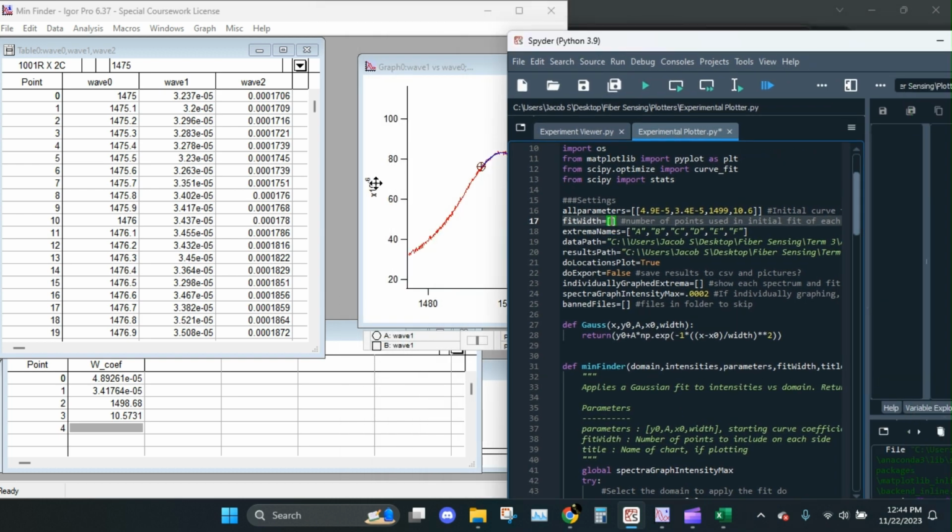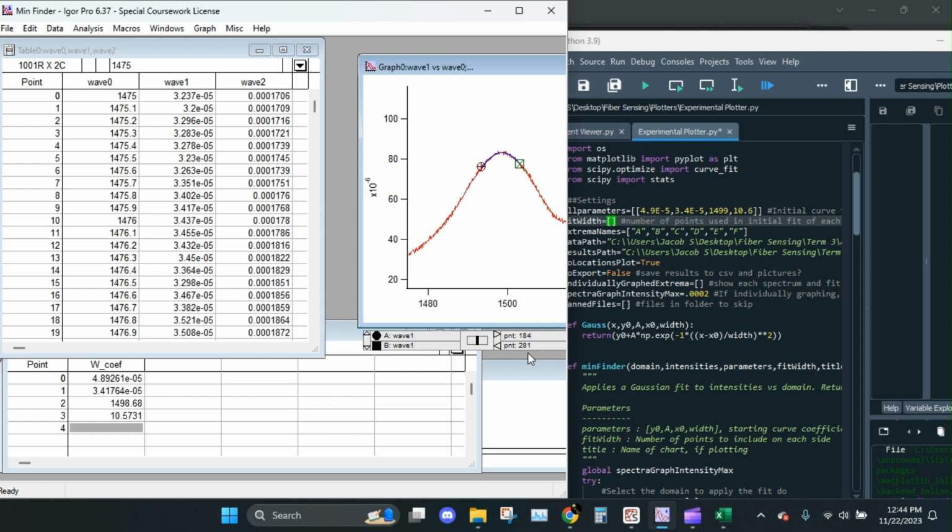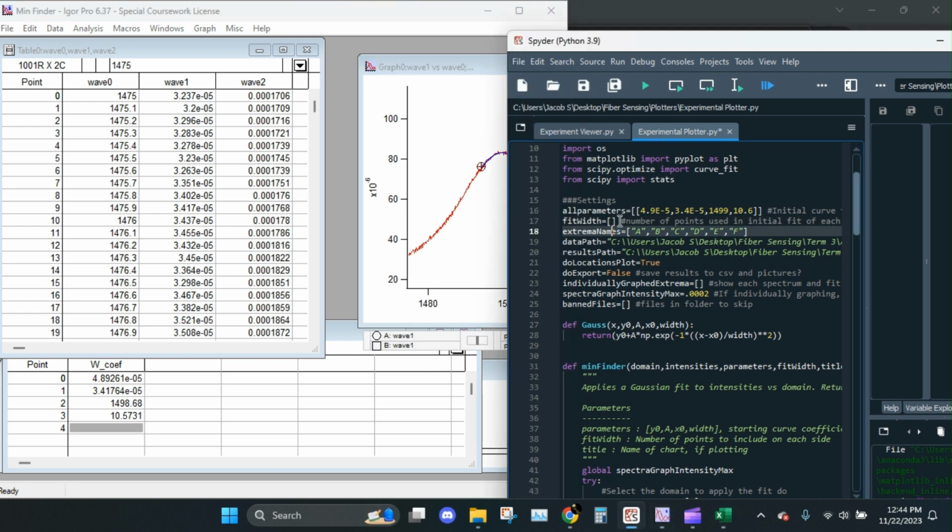So in this example, you can see here we have point 281 and 184. So that's 3 less than 100, so 97 points. And the importance of that is that we can't apply a Gaussian curve fit to the entire range of data. Of course, right? It's not just one curve, it's a lot of curves. So this is how I tell it how wide of a domain to select, right? Now we're going to repeat that for all the other ones you want to do.